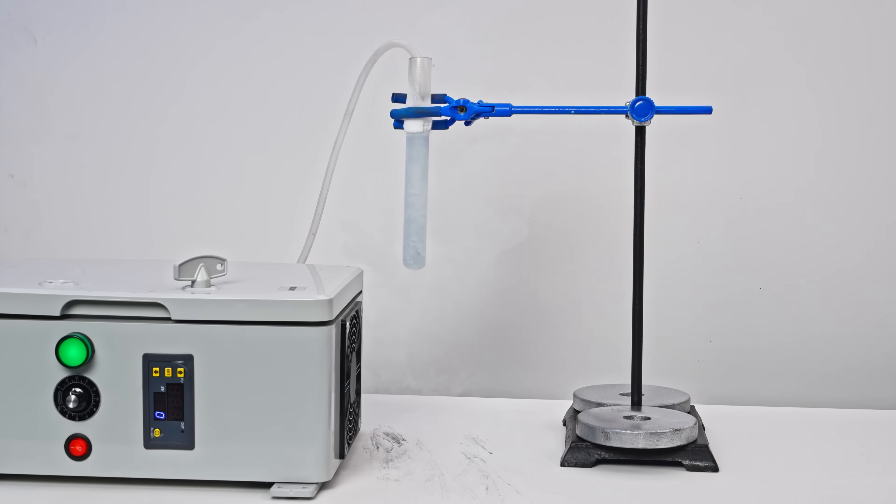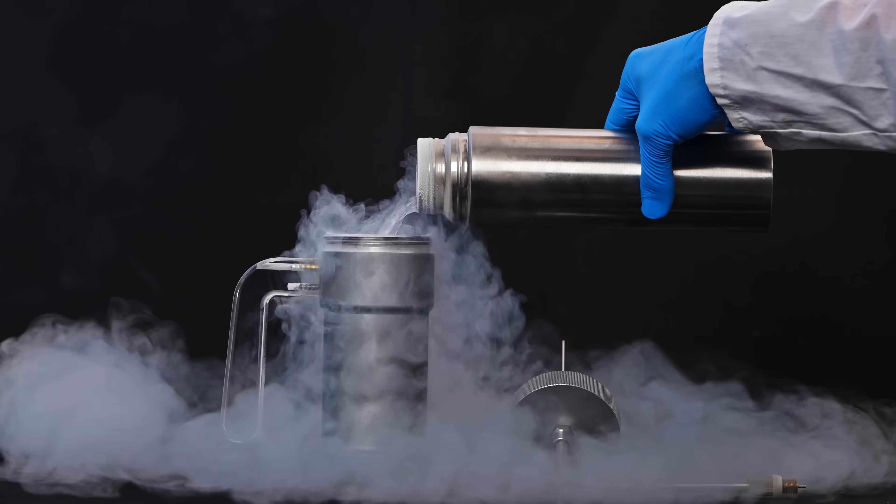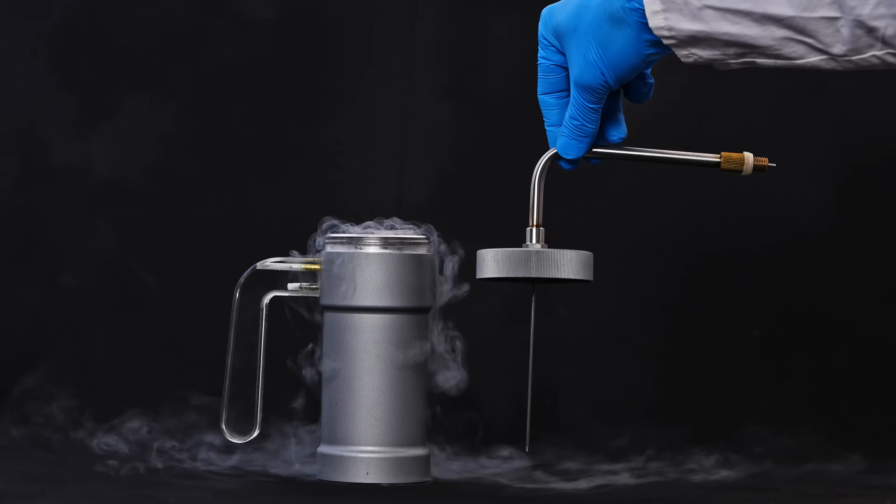To enhance this effect, we need stronger cooling. For this purpose, I'll use a liquid nitrogen sprayer.